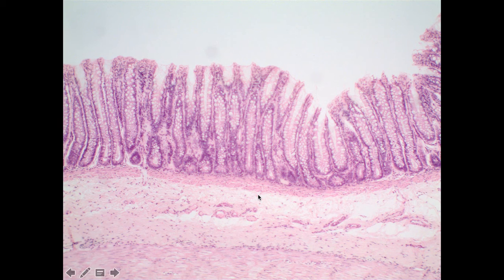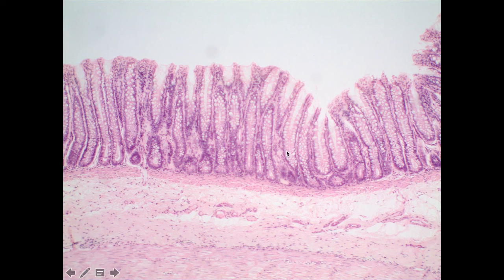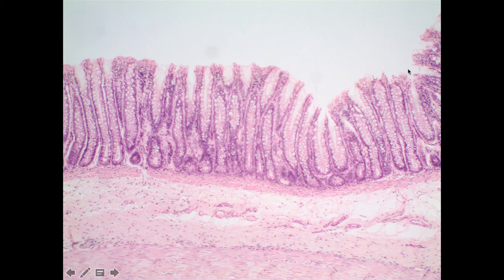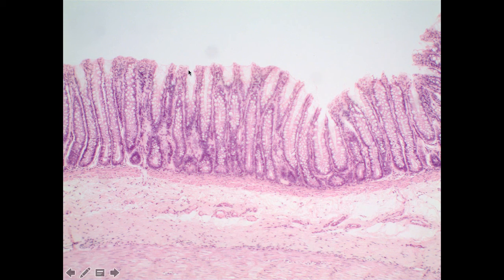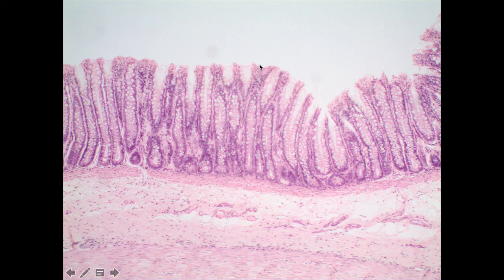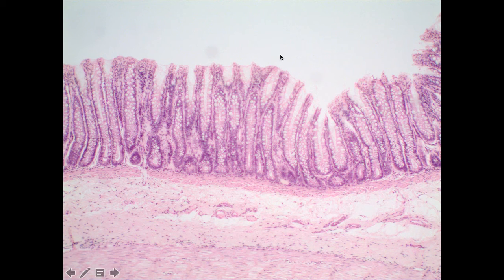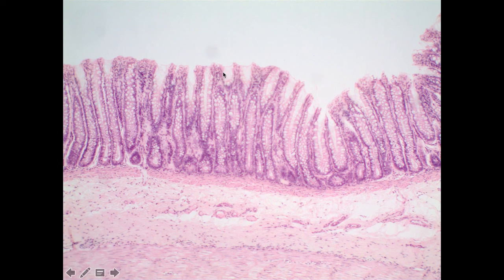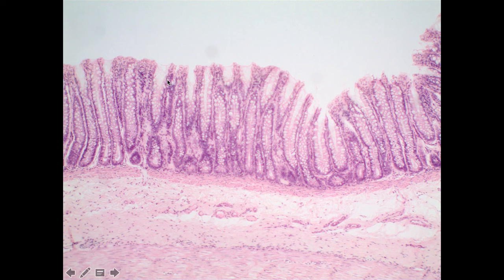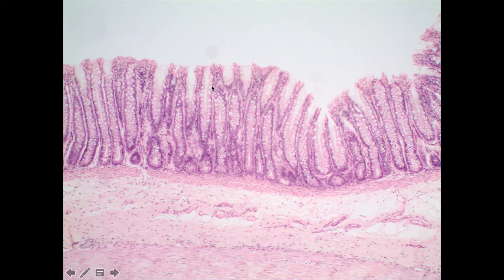The last region is the large intestine. The thing to note here is there are a lot of goblet cells — even at this magnification we can see many goblet cells as part of the epithelial lining. You'll also notice there are no villi; villi are unique to the small intestines. What we see here are very prominent crypts or pits extending down, similar to the stomach, but no finger-like projections extending up. So the absence of villi tells you you're in the large intestine. The prominent goblet cells and lack of villi are the features to use to identify the large intestine.